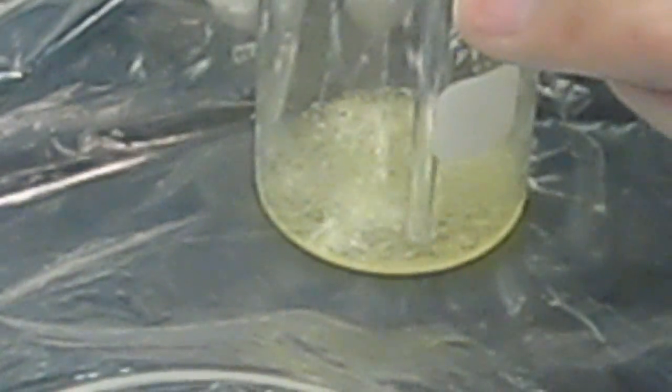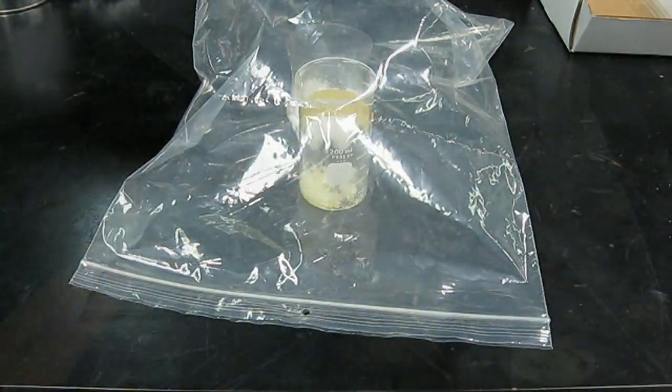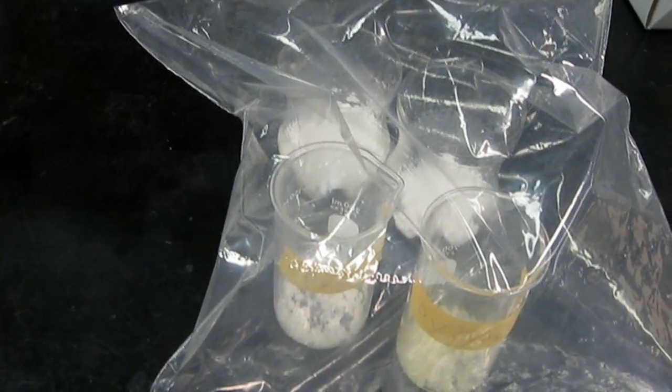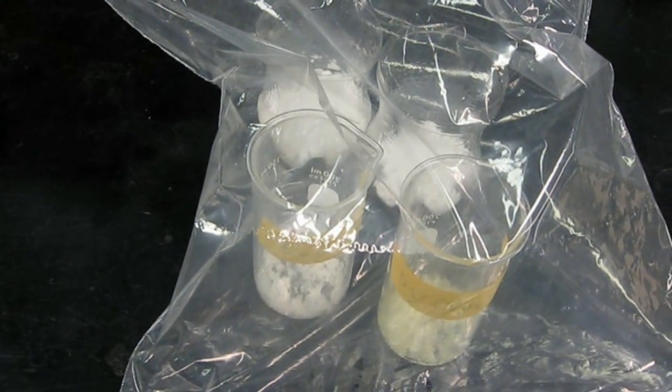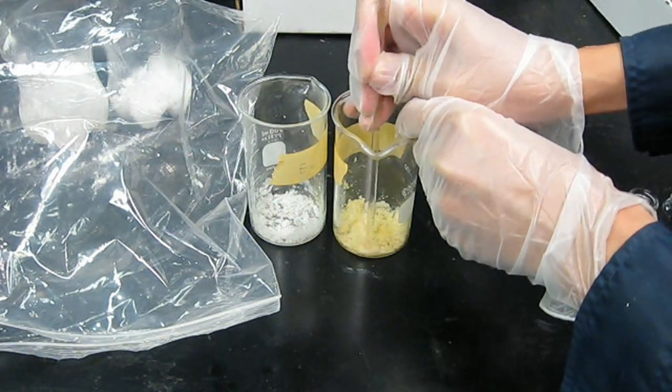Now sometimes the top part of the chemical dries out before the bottom part so you should poke your chemical with a glass rod and grind it. If it's still mushy underneath then grind it thoroughly to expose as much of it as possible and then put it back in the bag. Repeat this process as often as needed. To save time you can also put multiple substances in the same bag as long as any gases they produce and their solvents are the same type. Eventually when you grind them they should crumble into solid dry powders.